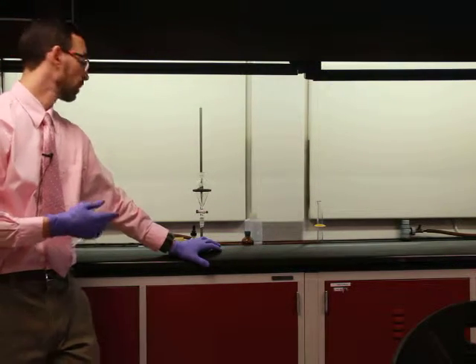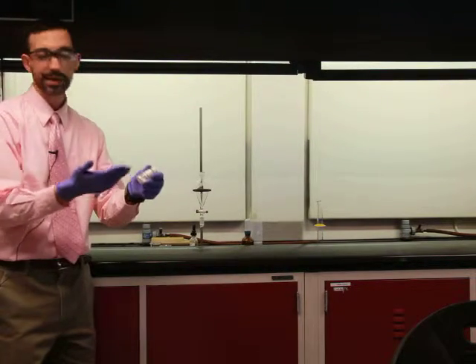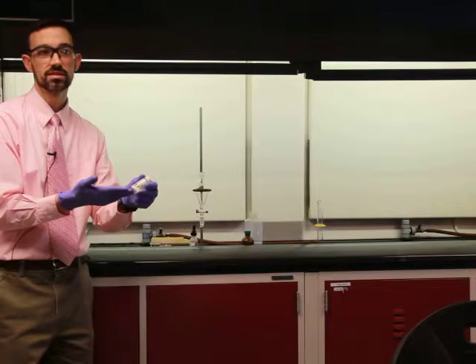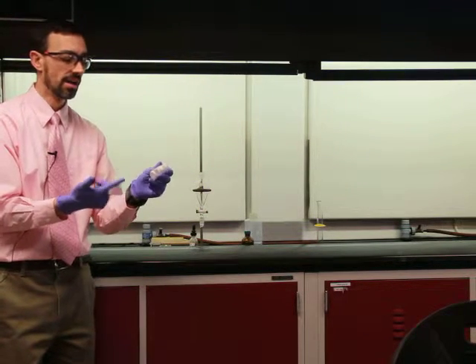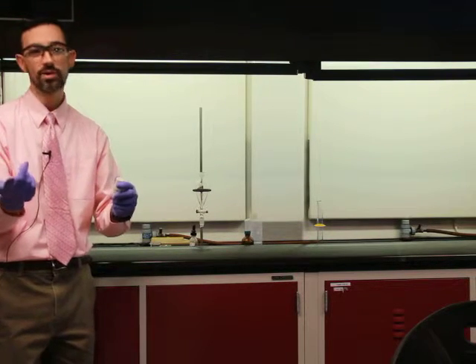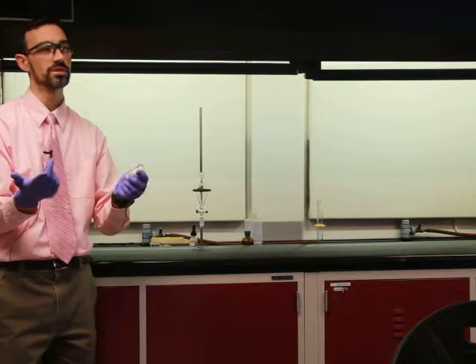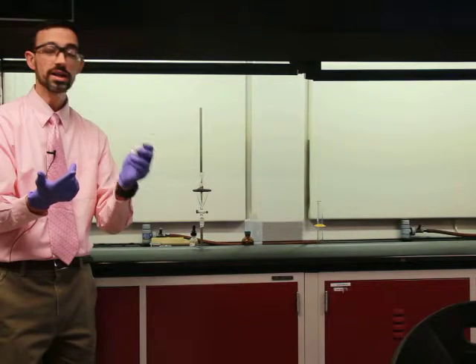Okay, so ideally what you would have done in lab today is weighed out like 1.5 grams of this. You don't know what it is. So you've got a bunch of things to figure out. A, what are your unknowns? That can't happen until the very end, actually. Melting points will be the way to determine the unknowns. But job number one is to separate them.